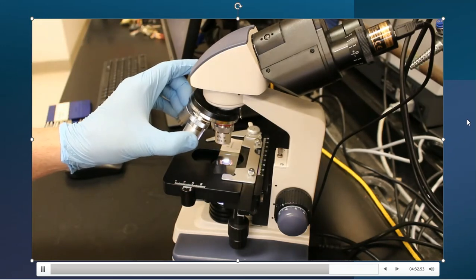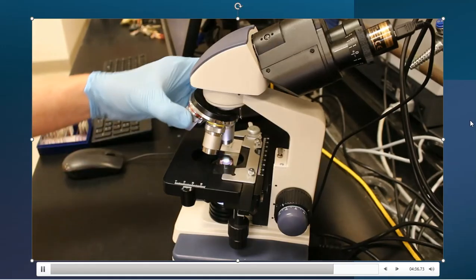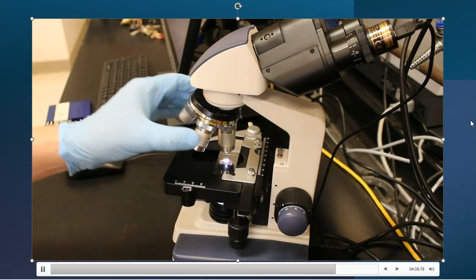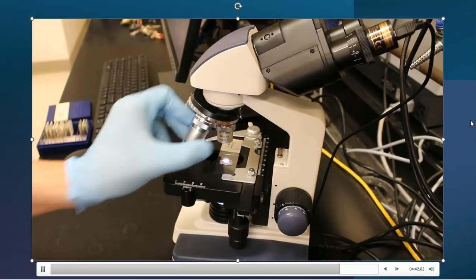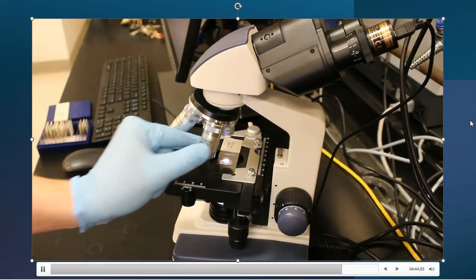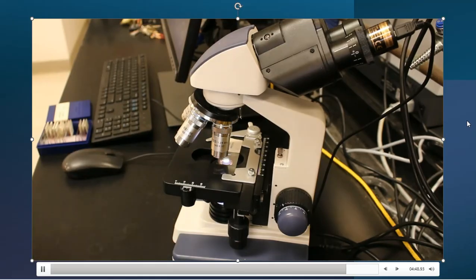And then this lab activity is going to make you turn and go to the next step, and then turn and go to the next step. And then the fourth magnifying lens you will not use. That fourth one is our highest power, and that highest power is a 100. But that very often requires a little bit of oil in order to get the lens down that close in order to see a picture.